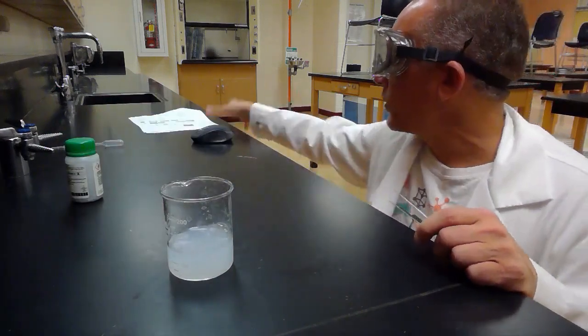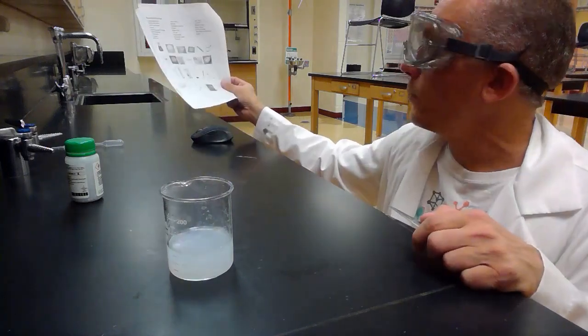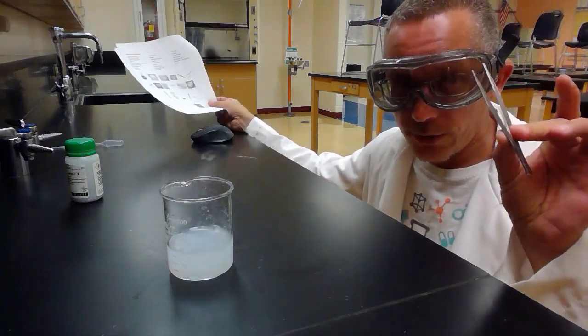So there we had picture O, the beaker, and picture F, the forceps.